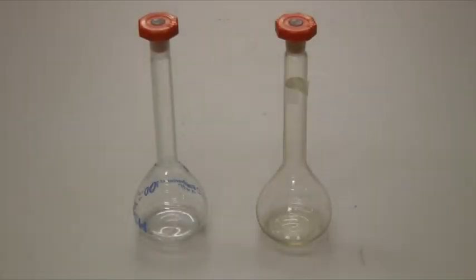Before carrying out your titration, you need to make up your standard solution. This is the solution whose volume and concentration are both known. This is normally made up in a volumetric flask. In many cases, the standard solution will have been made up for you already.